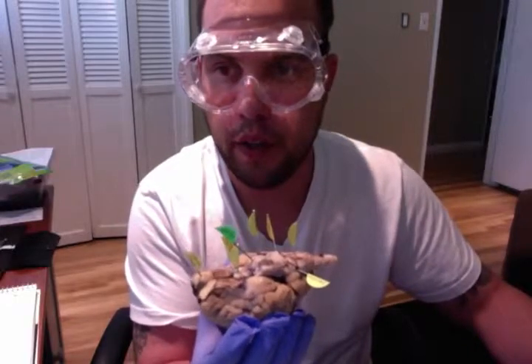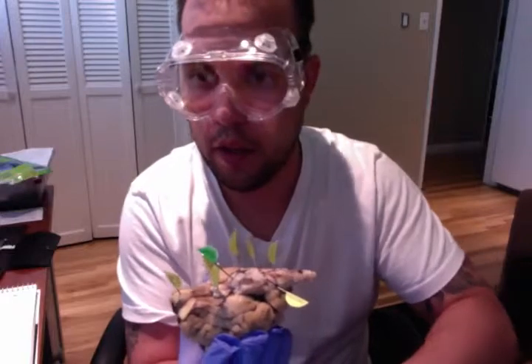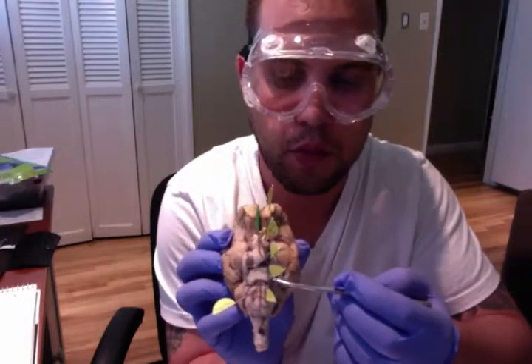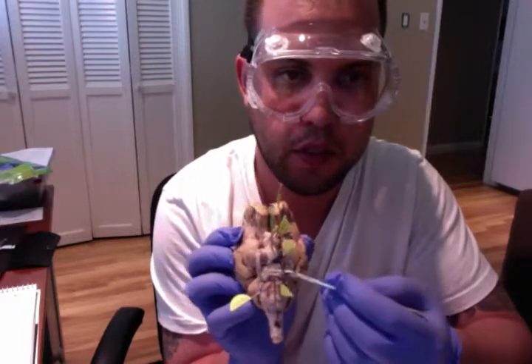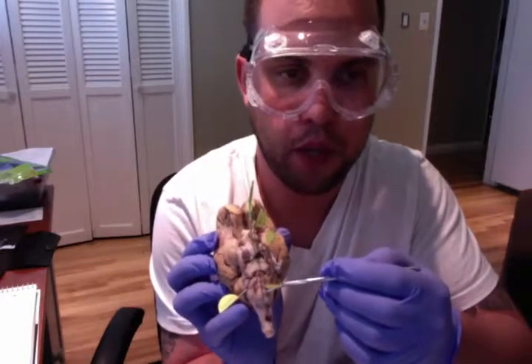Moving on to the pons, if I were to turn our specimen over, I will show you different regions of the brain, that being on the ventral side of the sheep brain. We have our pons located right here. This is our pons. I'll remove this so that we can see that this is our pons. And just below that, we have our medulla oblongata.